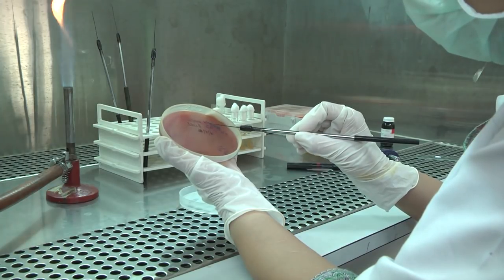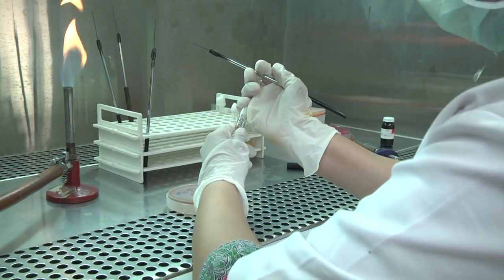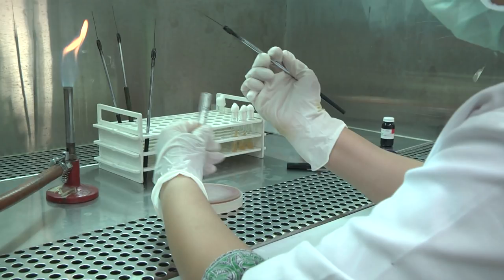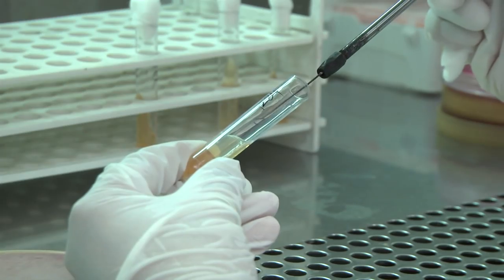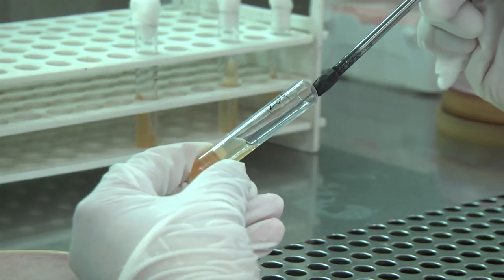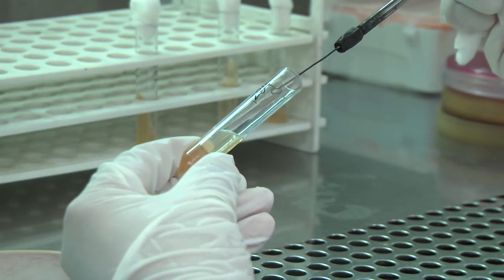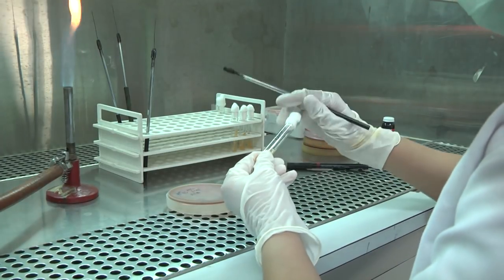Load the inoculum onto a sterilized wire loop. Hold the agar slant medium in your left hand and remove the cotton plug or cap of the agar slant medium with the little finger of your hand and flame the neck. Then, using the loaded inoculating wire loop, gently streak across the surface of the slant in a zig-zag fashion, taking care not to break the agar with the loop.